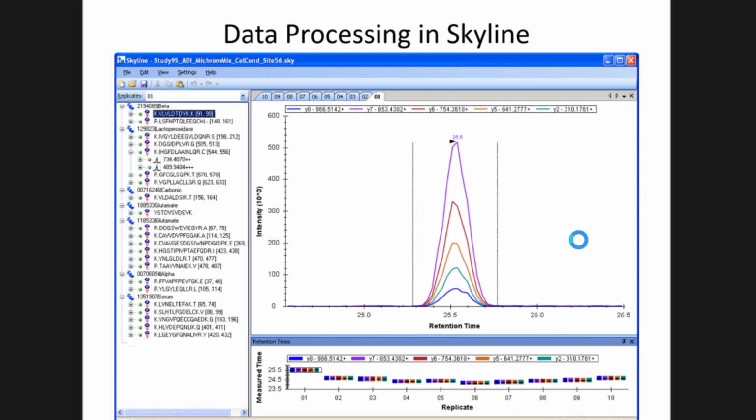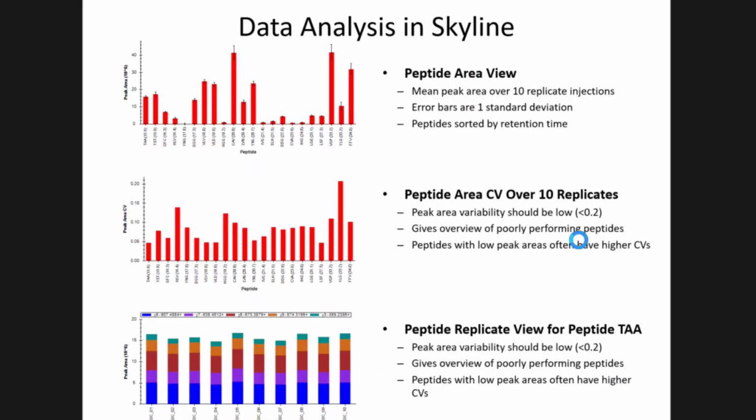Some of it can be explained. A new column might have later retention times because it hasn't been conditioned yet, and your peptides might linger a little longer interacting with the stationary phase, and their retention times might be a little later. And then as it's conditioned, it will stabilize. If the column's aging, you might see it drift in a different direction. So the retention time replicate view is very handy in Skyline.